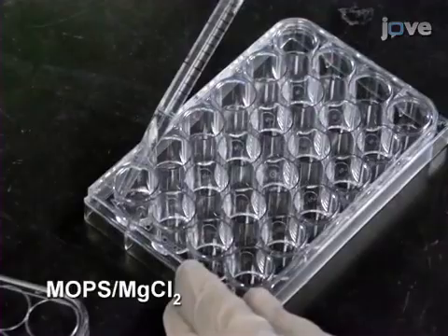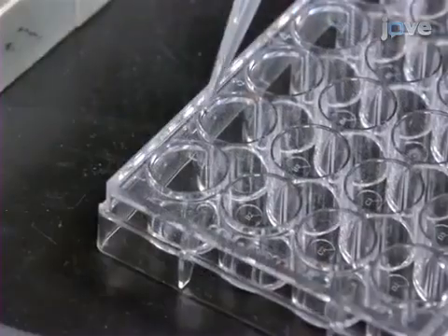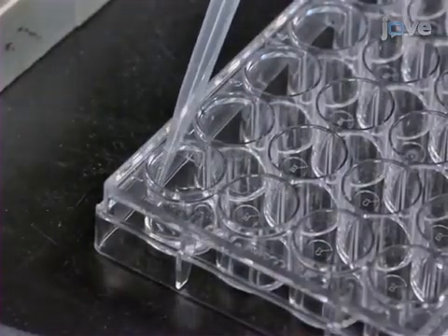Rinse the infected cells once, gently. Then add Alexa Fluor 647 coupled antibody.